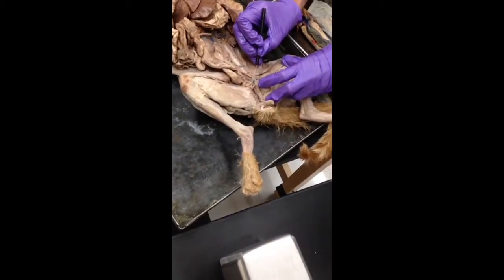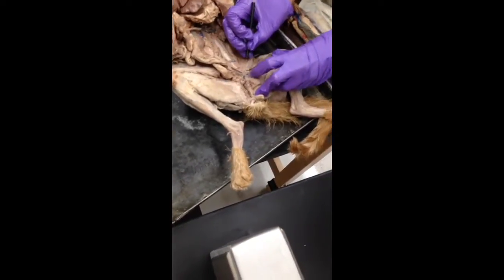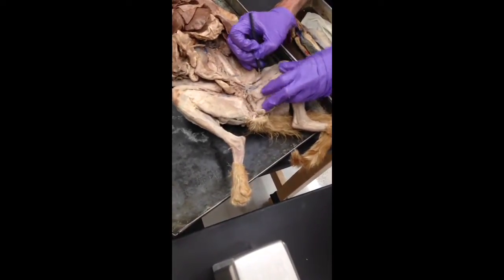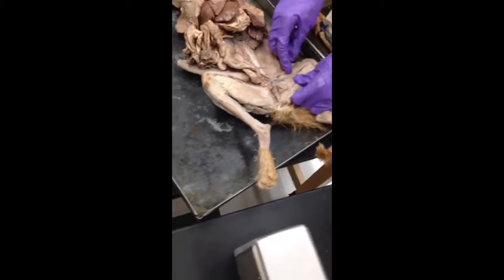But you can kind of tell where the femoral starts because you've got this thing coming off and then that coming off. So they both, after this branch, are now both the femoral. And you just remember that because that's the femur. That bone in there is the femur.